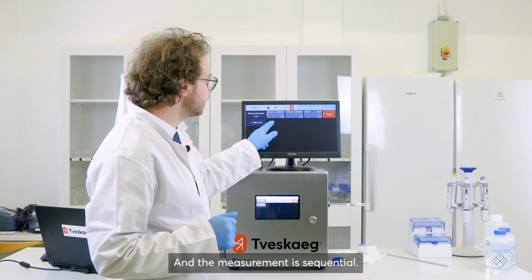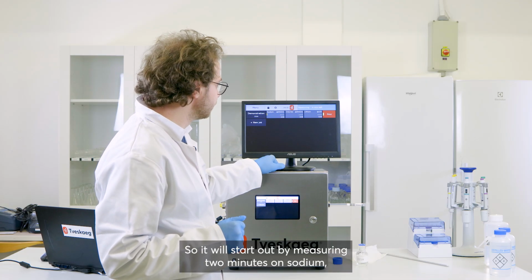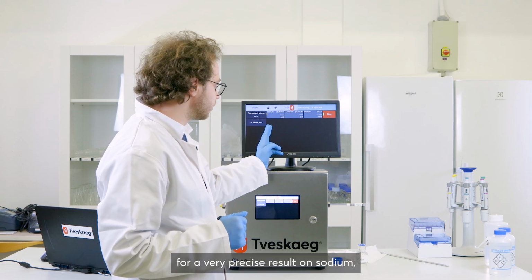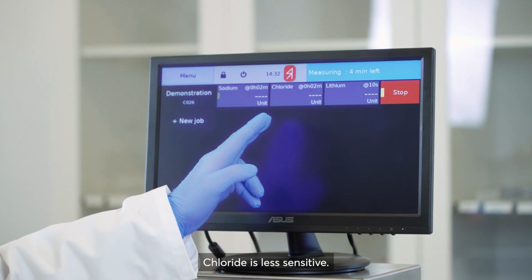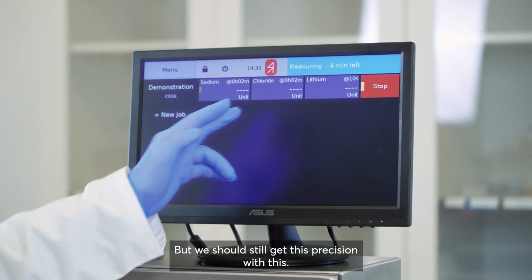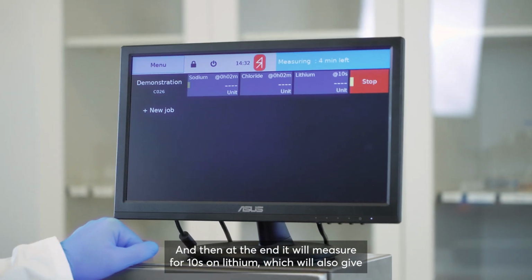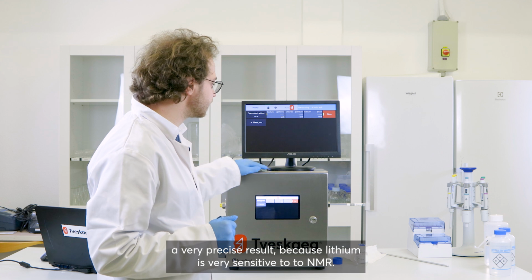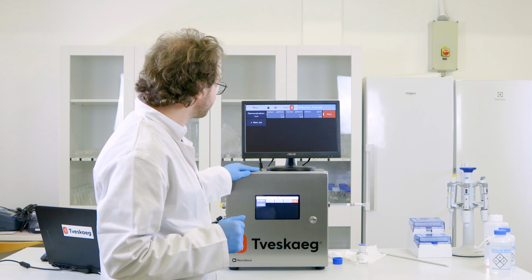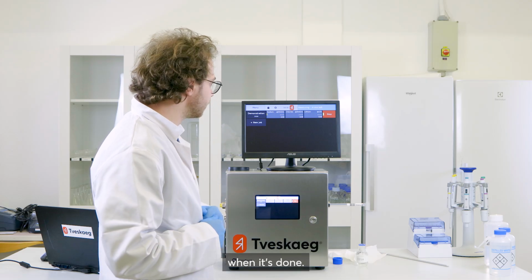The measurement is sequential, so it will start out by measuring 2 minutes on sodium for a very precise result on sodium. Then it will measure for 2 minutes on chloride. Chloride is less sensitive, but we should still get decent precision with this. And then at the end, it will measure for 10 seconds on lithium, which will also give a very precise result because lithium is very sensitive to NMR. I'll just leave this running, and then we can have a look at the result when it's done.